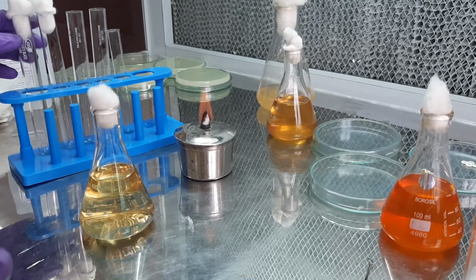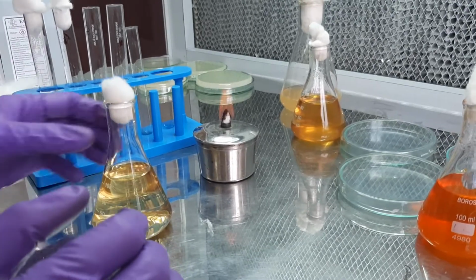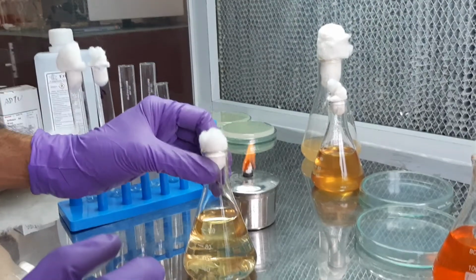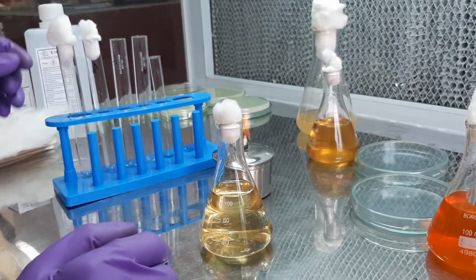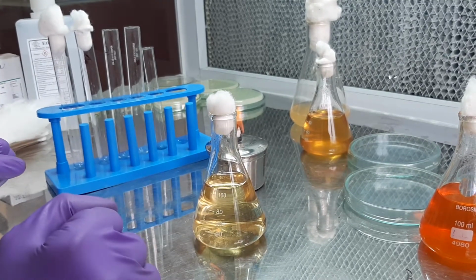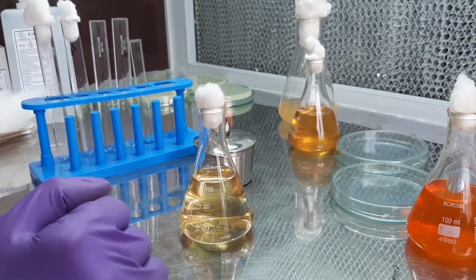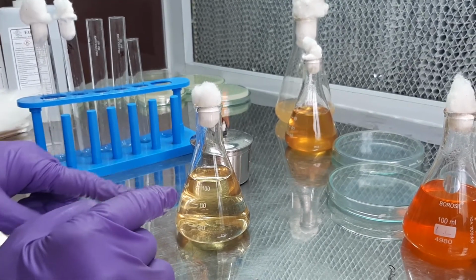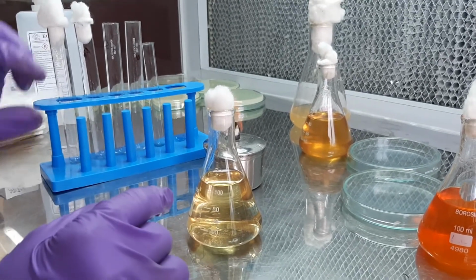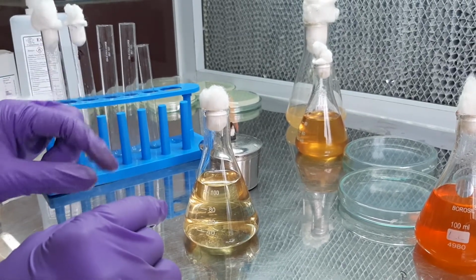Hello everyone, this video is to carry out the indole production test. It is a biochemical test wherein we use tryptophan broth, and the tryptophan present in this broth can be broken down by certain microorganisms with the help of the tryptophanase enzyme. Microorganisms like E. coli can produce that enzyme, and thereby they are capable of breaking down tryptophan to produce indole. And that indole can be detected when we add Kovacs reagent to it.